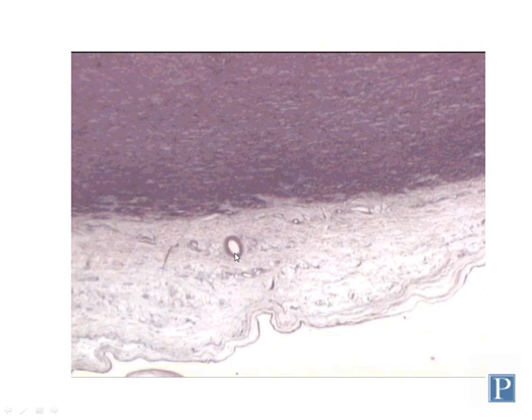These structures are called vasa vasorum, which means blood vessels within the blood vessel. And you find these in the outer parts, the outer walls of large arteries and large veins, mainly in the tunica adventitia, but you can also find them sometimes in the outer portions of the tunica media. You find these structures in large arteries and veins because the outer portions of the walls are so large that they can no longer rely on getting their nutrients from diffusion from the blood that's being carried way up here in the lumen. And so these outer layers of the wall have their own blood supply because the tissue is so thick.